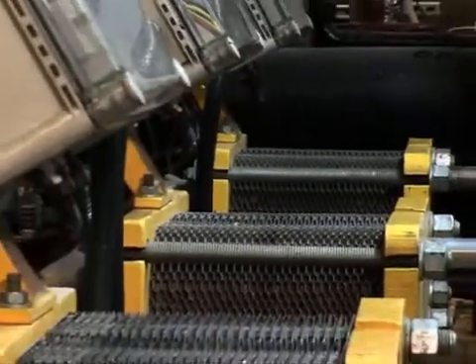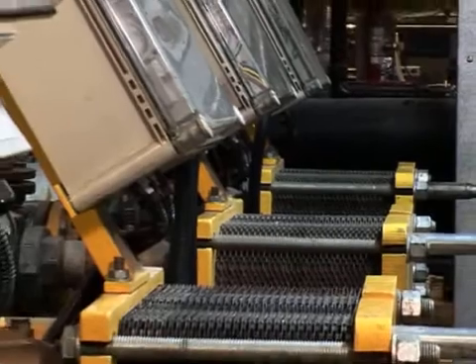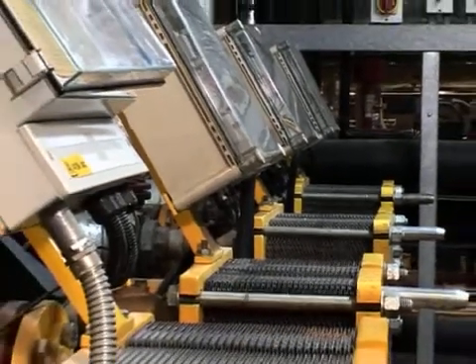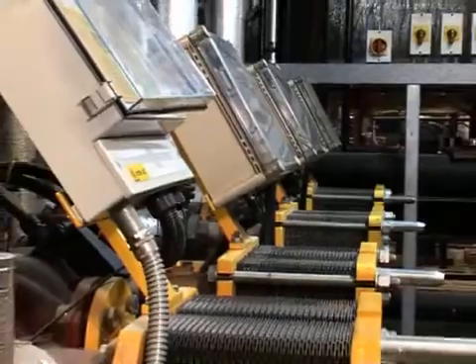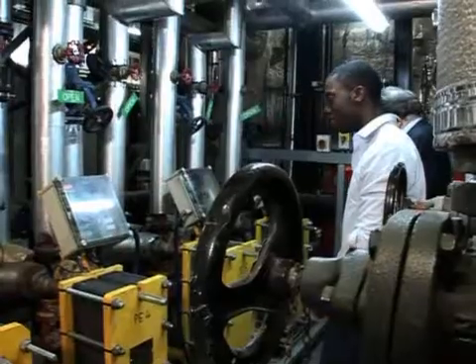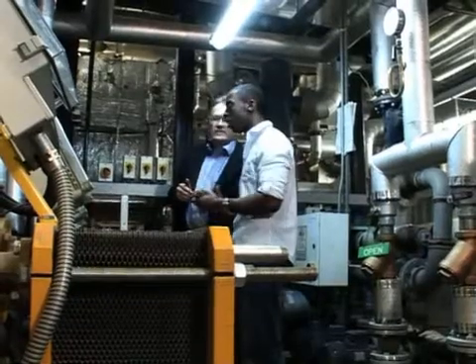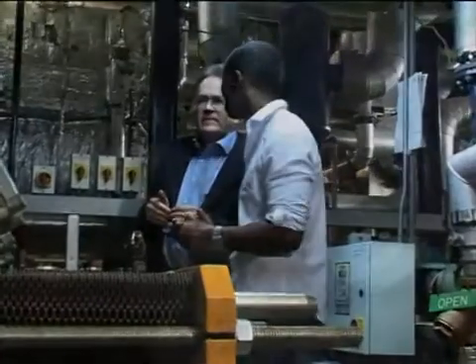Increasingly, plate heat exchangers are used. Whilst these are not a focus for growth, a hot water storage or buffer vessel installed with them can be. If a suitable drain valve is available, a sample should be collected.